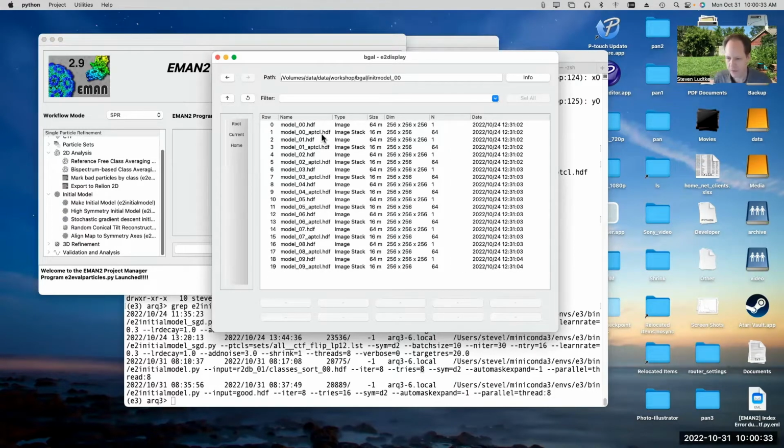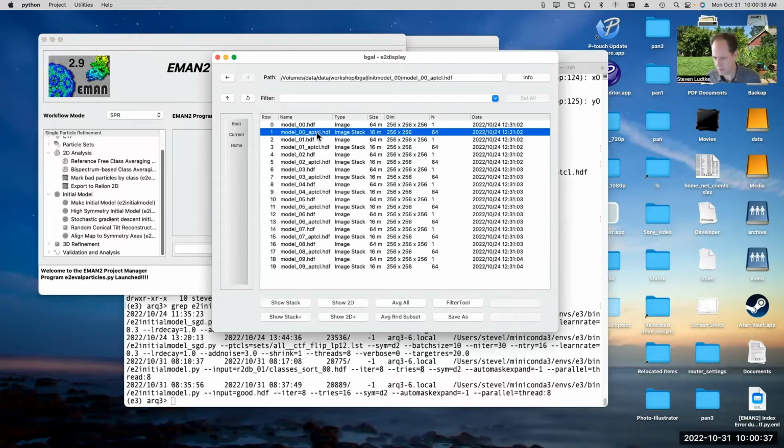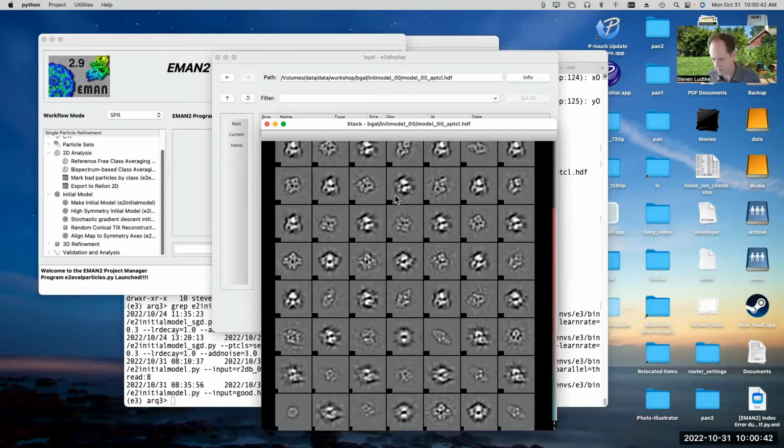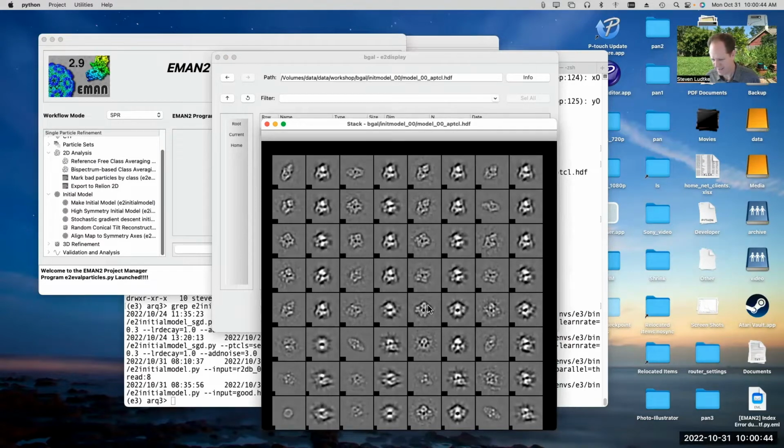There, init model 0. So I ran this the first time, I used class averages as inputs. And if we look at the A particle file, you can see some of them agree kind of, but it didn't really do a terrific job.